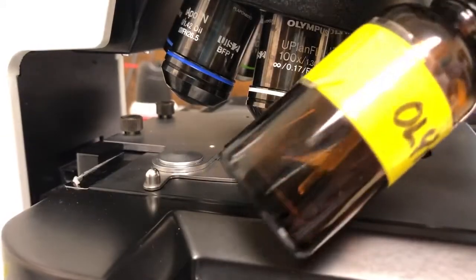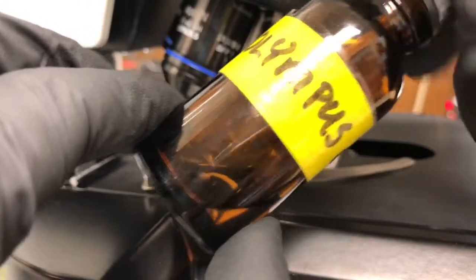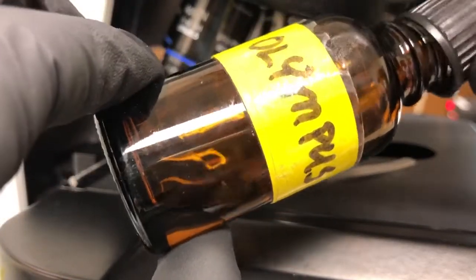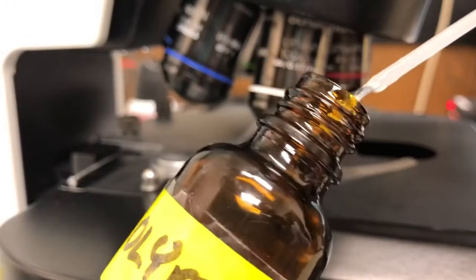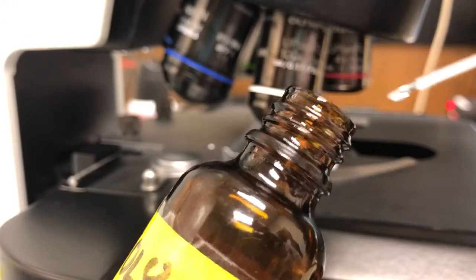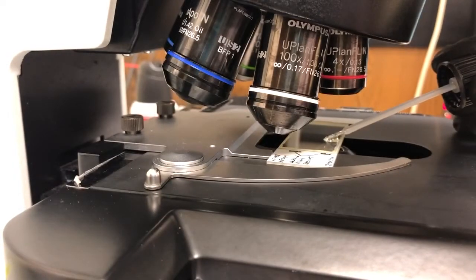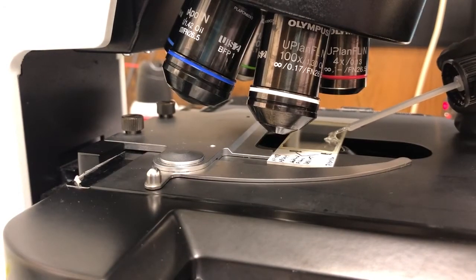The oil bottle is always on the table. You can see if you tilt it you can see the oil inside. I'm going to dip this little plastic spatula into the oil and then I'm going to apply that roughly in the position where I then want to place the objective.